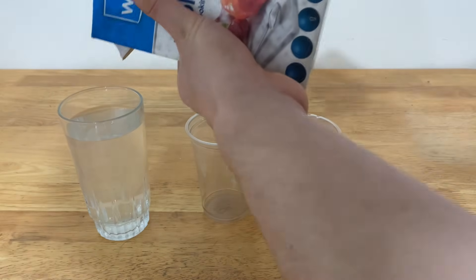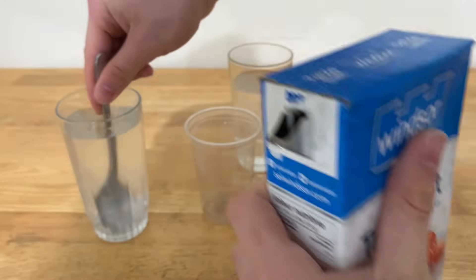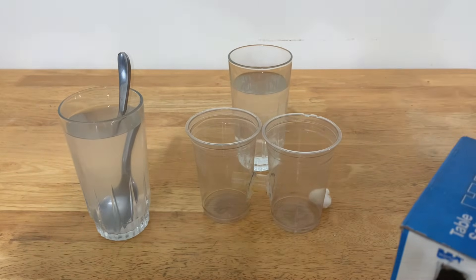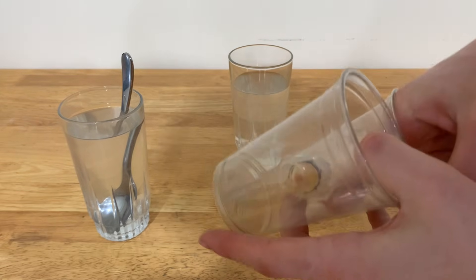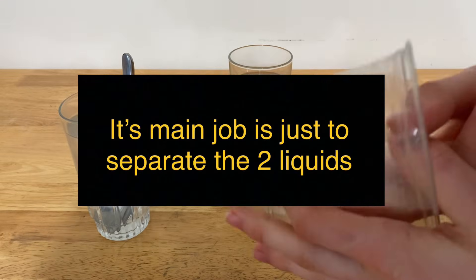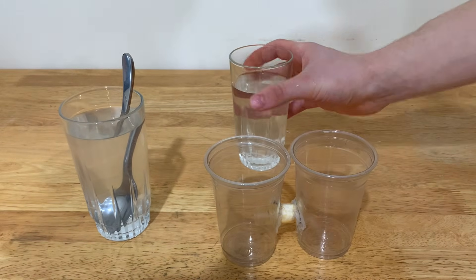I did show how I do this before in another video. So I'm just pouring salt in, and while I'm pouring it in I'm mixing it. I need this solution of water to be as concentrated as possible with salt. A quick summary of how I use this electrolyzer: I get a piece of cotton and put it in the tube between the sections — cotton just thick enough so it covers the passageway.